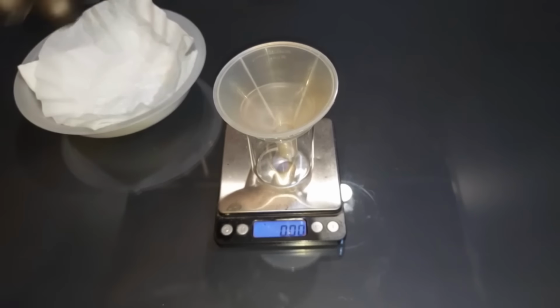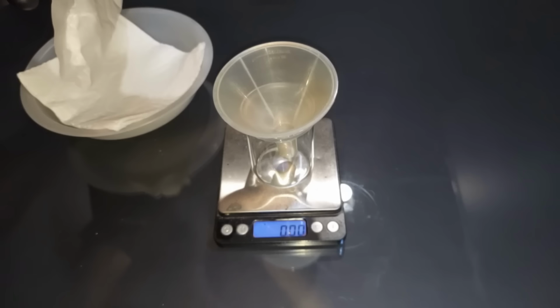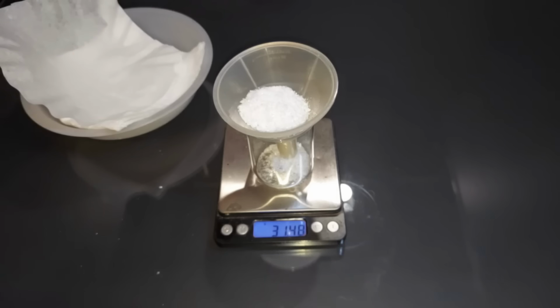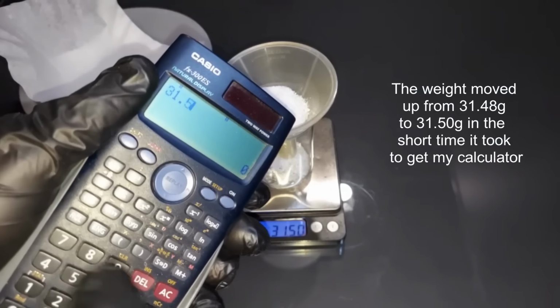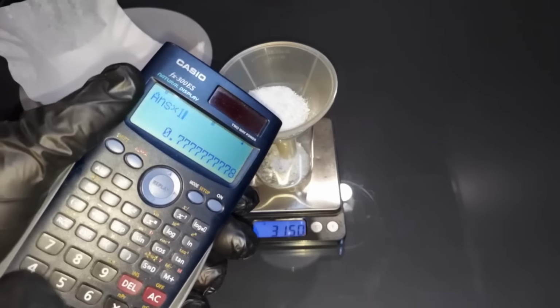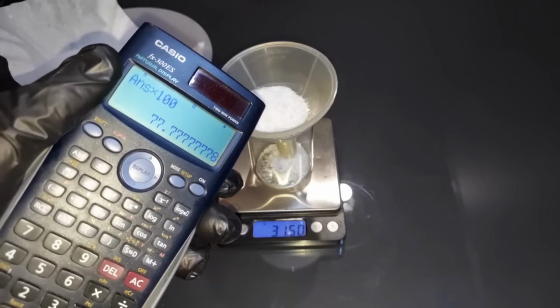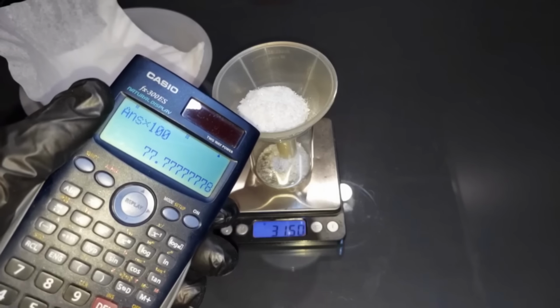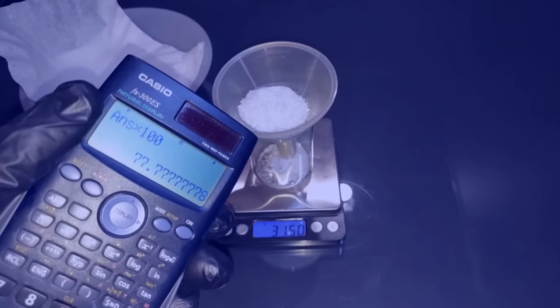Okay, let's weigh this. The expected yield is 40.5 grams. That's 40.5 grams. And we got 31.48. That's 77.8%, which isn't really great, but it's not terrible either. Either way, we have plenty to move on to the next experiment using this, which will be making potassium ferrioxalate in a future video.